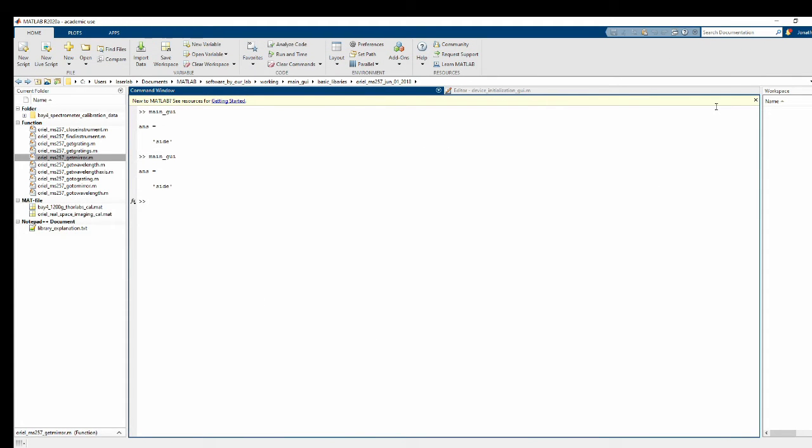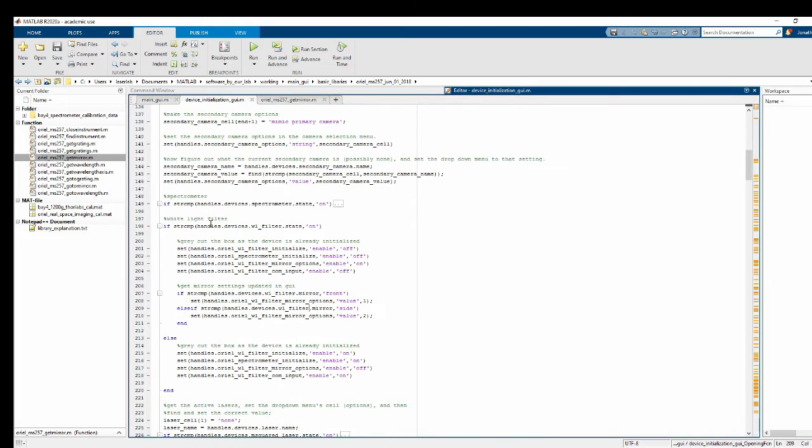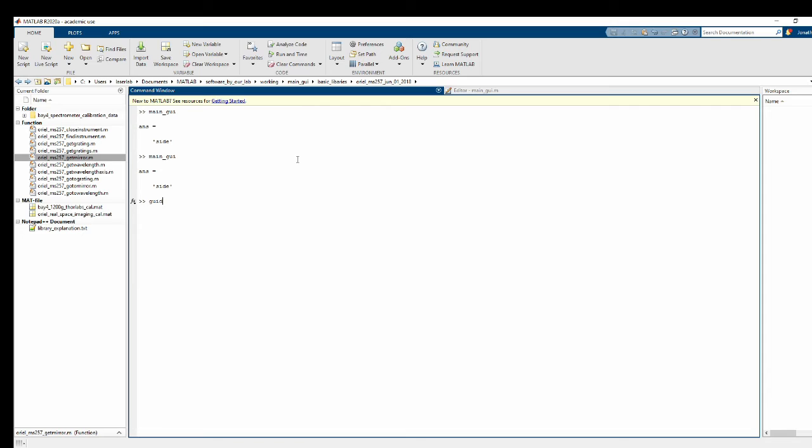All right, let me check my notes. All right, I think the next thing to do is to work with main GUI. Let me just double check. If string comp, yes, okay, we're all caught up now. So now what we want to do is start editing the main GUI code. So we can go back to main GUI, and we're going to want to add some buttons. So we go ahead and open up main GUI with guide.